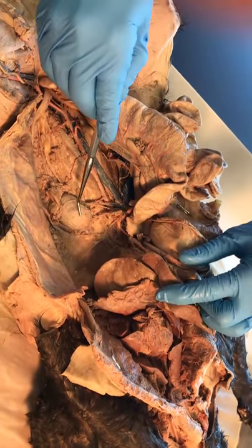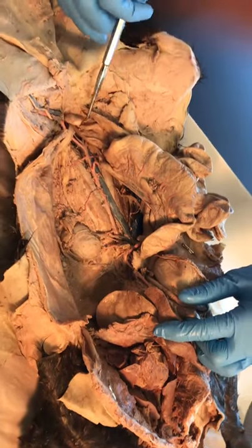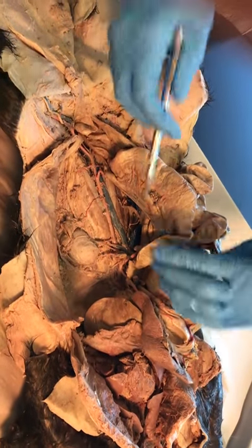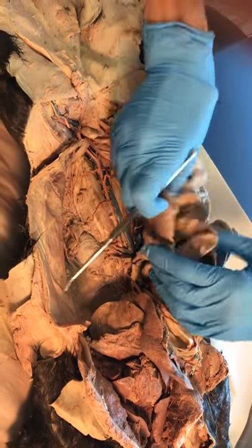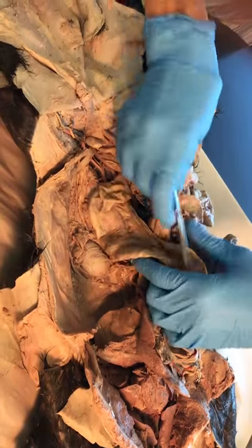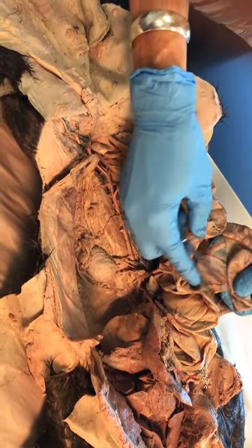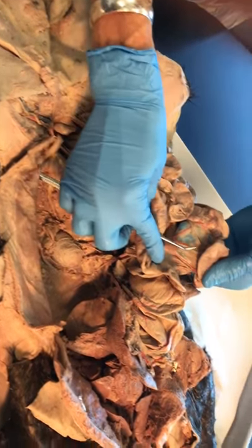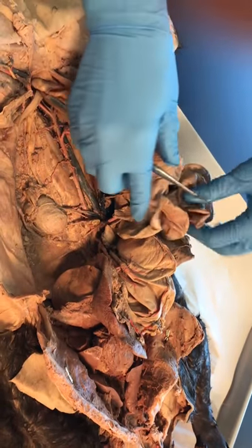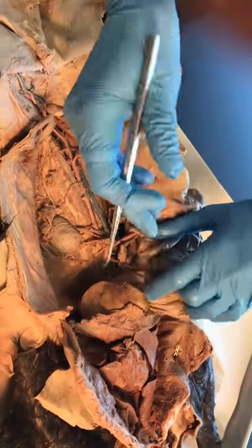Here's the kidney, here's the bladder, here are the intestines in between, and here's the mesentery. Now let's look at the veins.